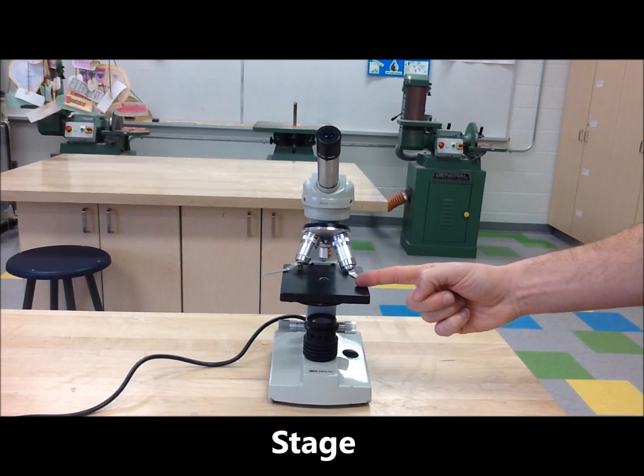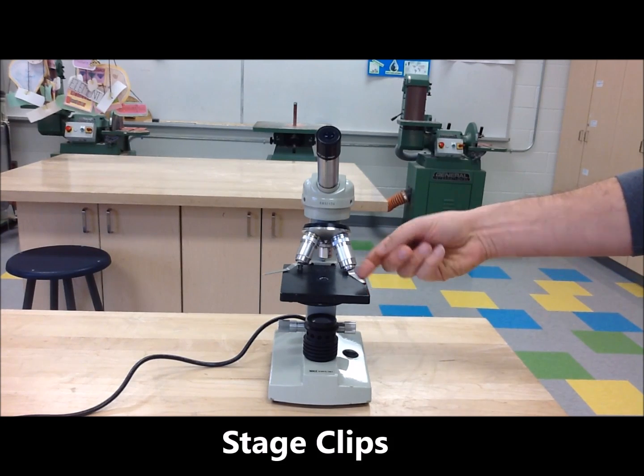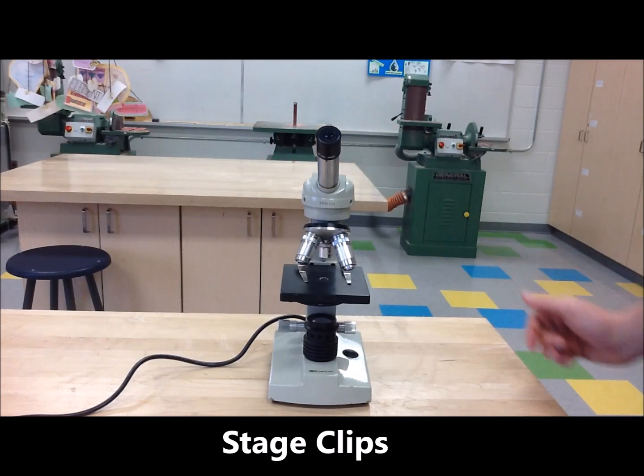Stage. It's a support for the slide. Stage Clips. Used to hold the slide in place so it doesn't move around.